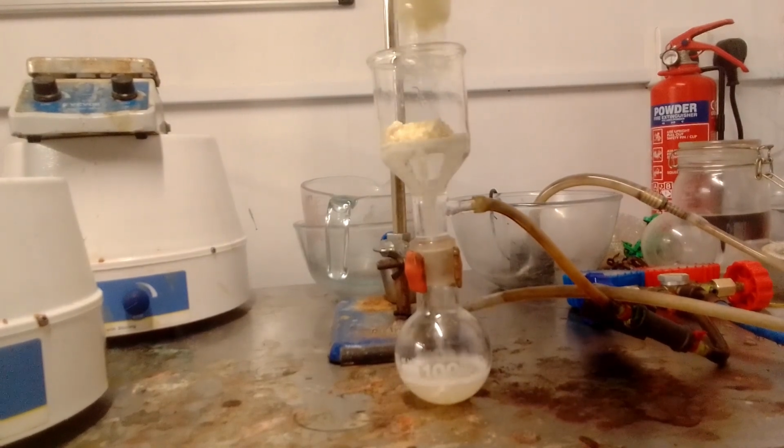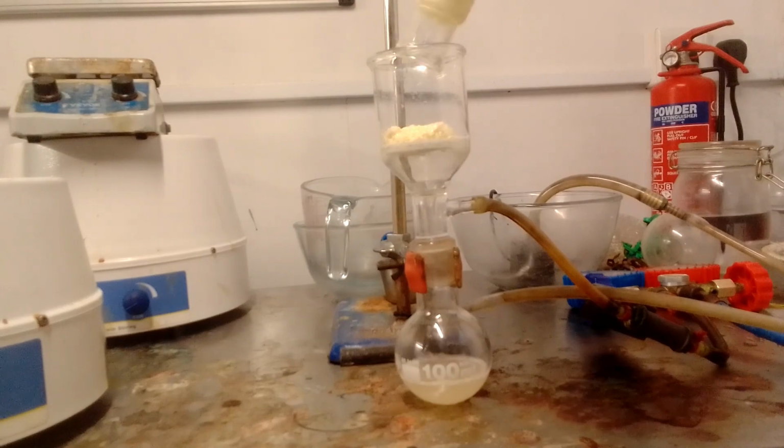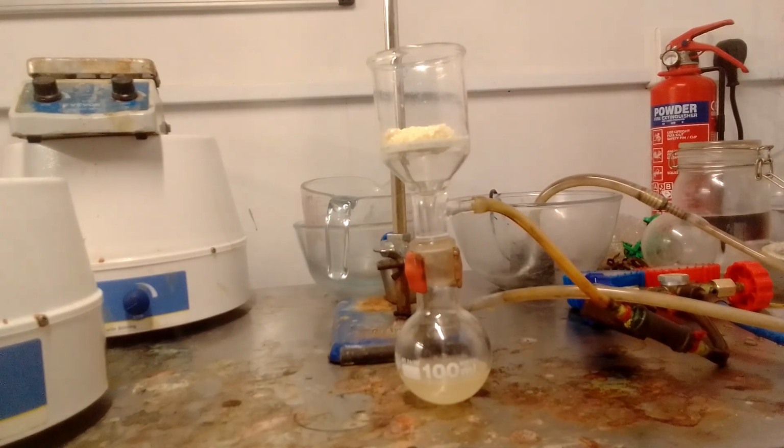The original paper used carbon tetrachloride to isolate the acid chloride. This is hard to come by, but perchloroethylene, which is used in dry cleaning and is chemically very similar, is much easier to find and produces excellent results. I didn't have this when I made the original video. It's possible that better yields could be achieved by refluxing the mixture instead of shaking it at room temperature.